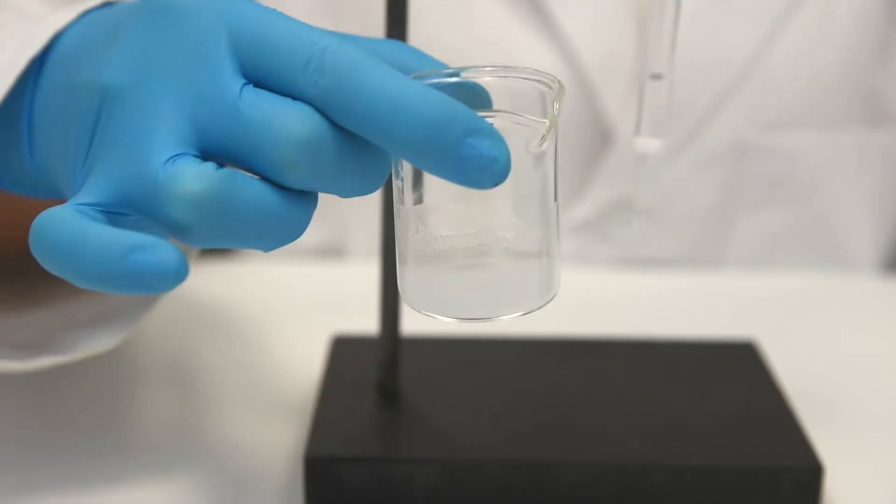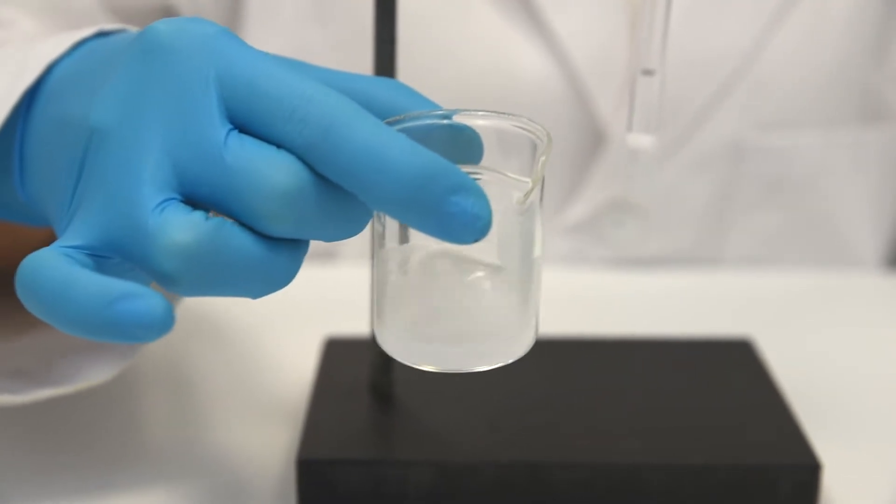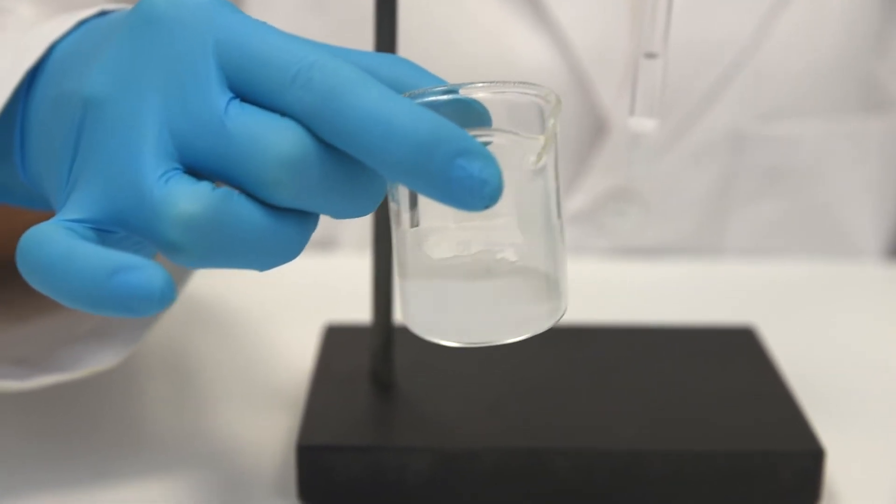Step 3: Mix the molecular sieve matrix thoroughly by swirling or gently stirring.